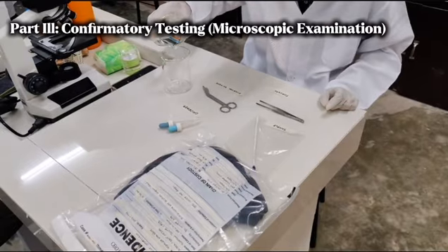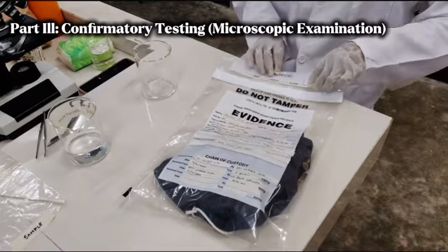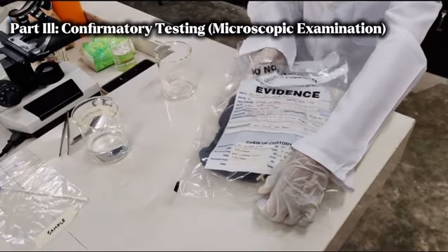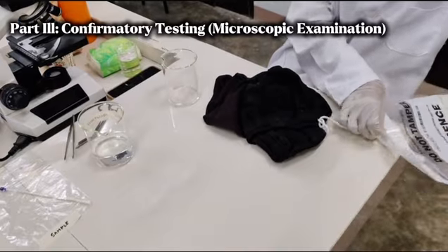Here is the process of conducting confirmatory testing or microscopic examination. Using a surgical scissor, we will cut some part of the cloth that contains the suspected seminal stain.